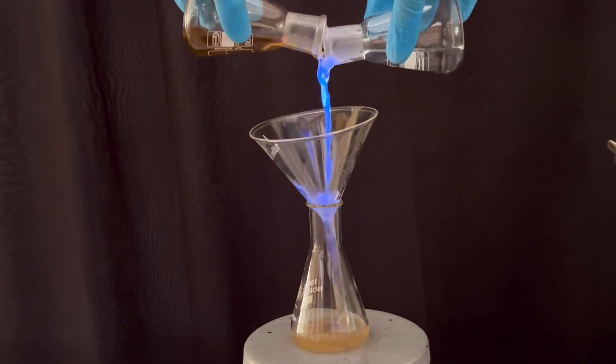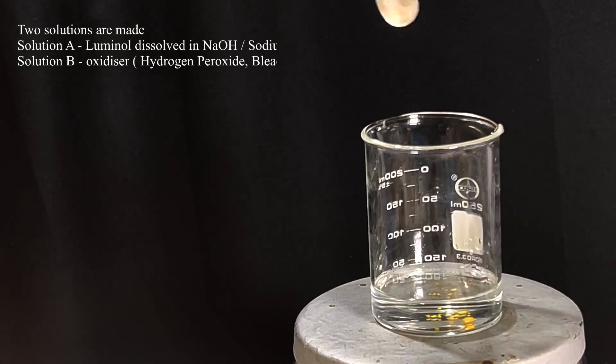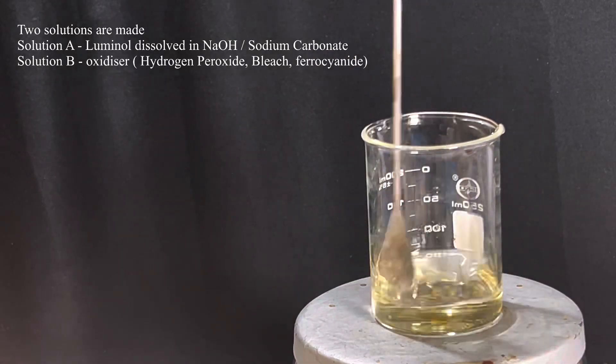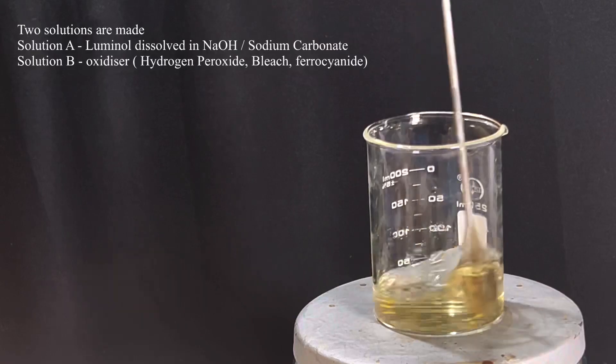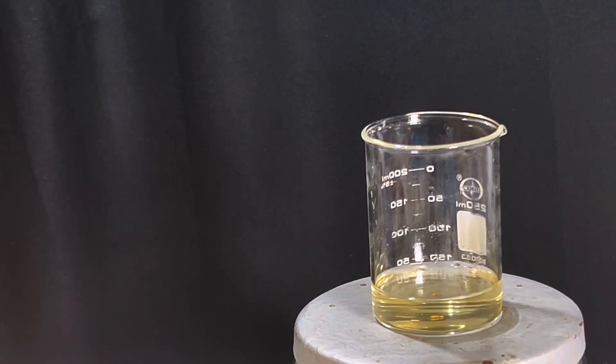For this demonstration you will need two solutions. Solution A is luminol dissolved in 5% sodium hydroxide solution. Solution B could be any oxidizer. In my case I am using dilute sodium hypochlorite solution. For the effect just mix them together.